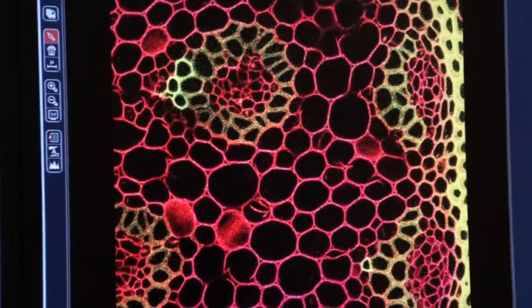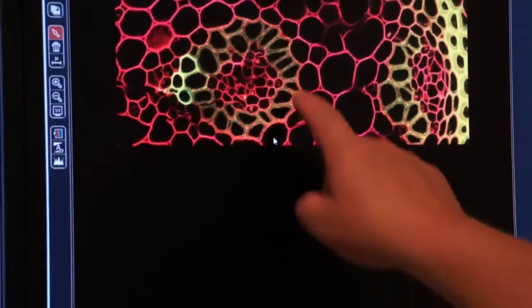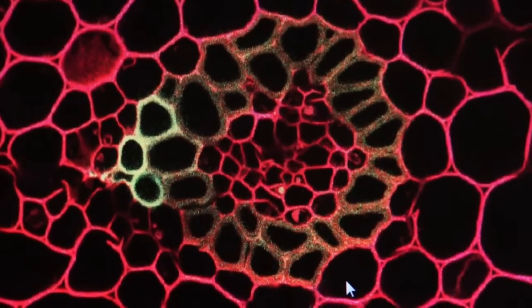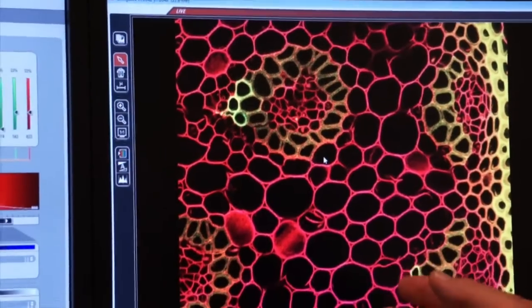Watch the right screen, and you'll see our new image come up. Again, it's slower. Why? We're scanning each line 5 times. But when you look at the resultant image, you'll see that a lot of the noise has gone away and a lot of the pixelation has gone away. So line averaging, frame averaging are very useful. Now remember, you see how slow the scan is because we're doing many averages.